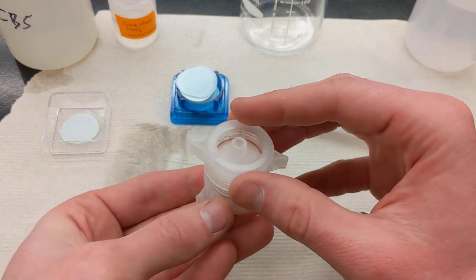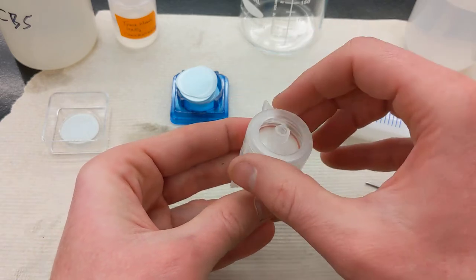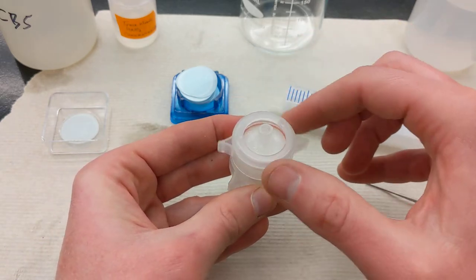Then you'll take your lock ring, drop it over the top, rotate it backwards a few turns or to the left to get the thread started, then go right.